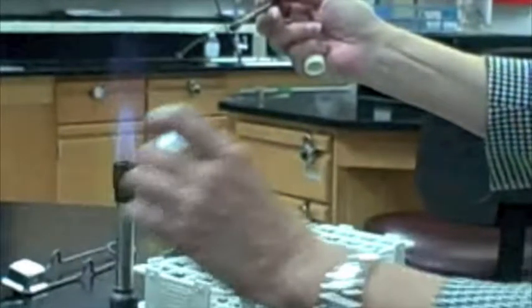Pass the top of the tube through the flame a few times. This will incinerate any contaminants on the edge of the tube. During all of our procedures, after opening a tube, the top should be passed through the flame. And before closing a tube, the top should be passed through a flame.